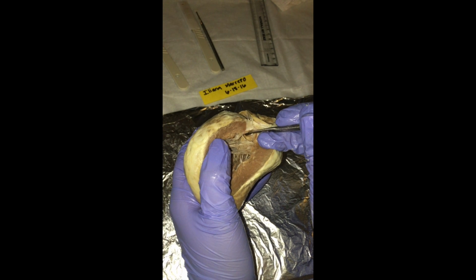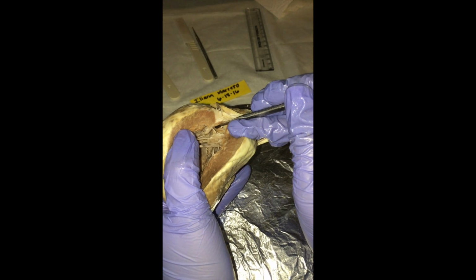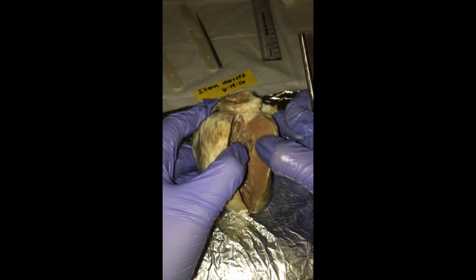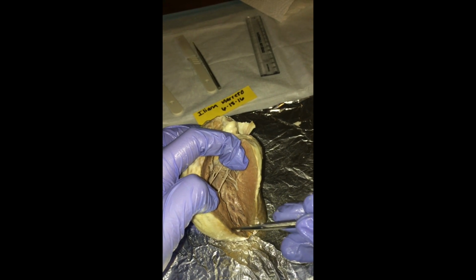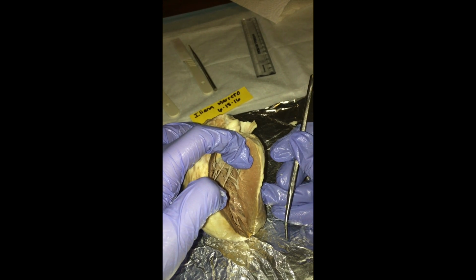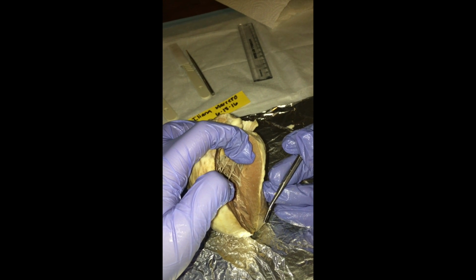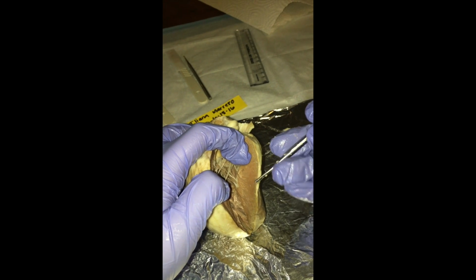So now we move on to the internal anatomy of the heart. Back here we show the pectinate muscles in the inner wall of the right atrium. Next we have the myocardium, which is this region right here and here. And the reason why the myocardium is 3 times thicker than the right ventricle is because the cardiac muscle, specialized tissue, has the ability to contract repeatedly and is resistant to fatigue.